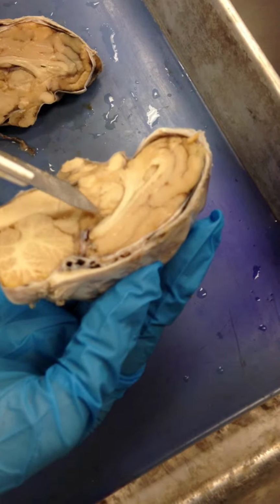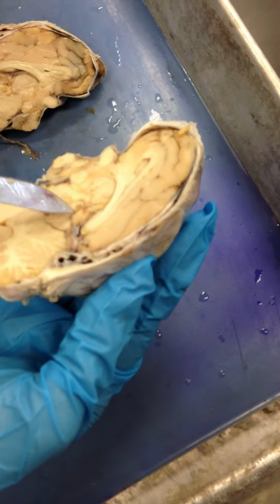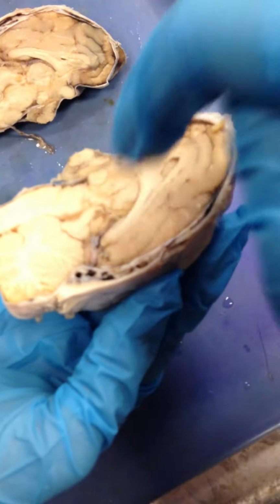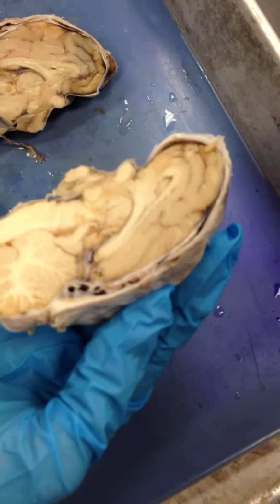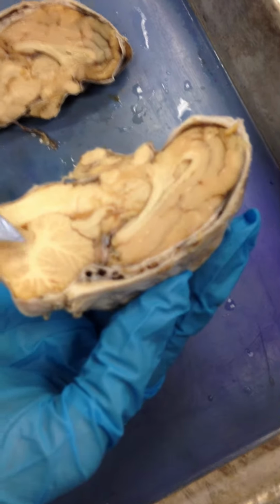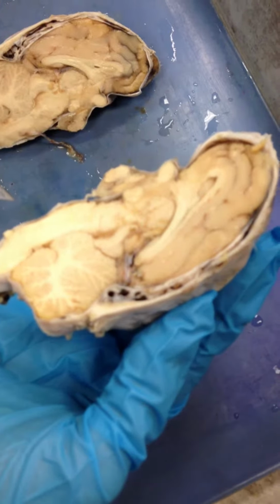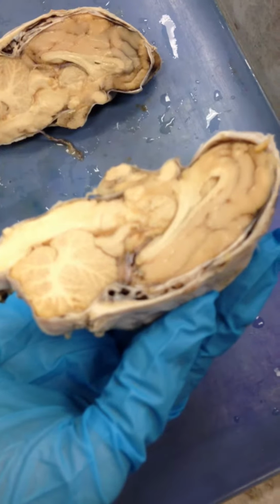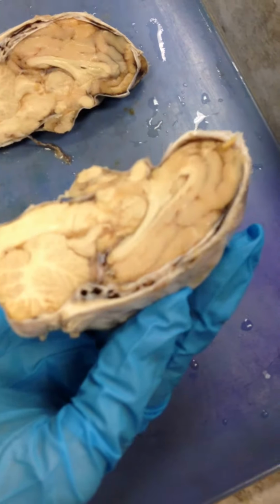Okay, then looks like this thing right here is the pineal gland. Yeah, right there. And then that thing is the hypothalamus, that area. Okay. And that's the cerebellum. And below the cerebellum is the fourth ventricle, somewhere in this area. And the hypothalamus, when he said it's really important, that's what we just pointed to. That area.